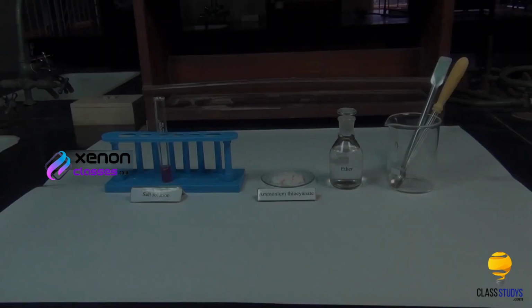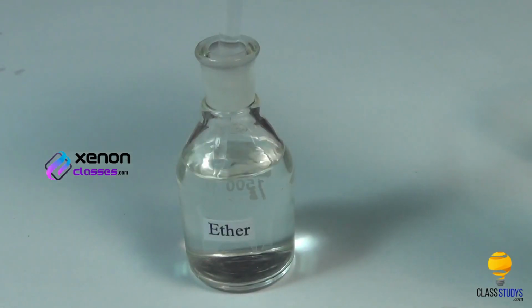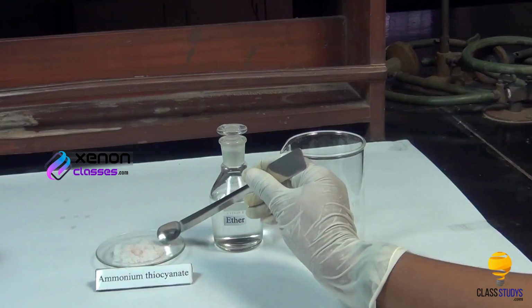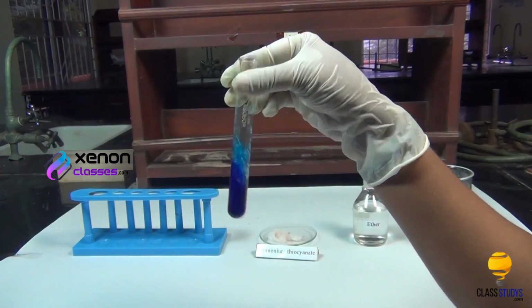Procedure: take a small quantity of salt solution in a test tube. Using the dropper, add a small quantity of ether to the solution. Ether forms a separate layer above the salt solution. Add a few crystals of ammonium thiocyanate to the solution. Shake the test tube well.